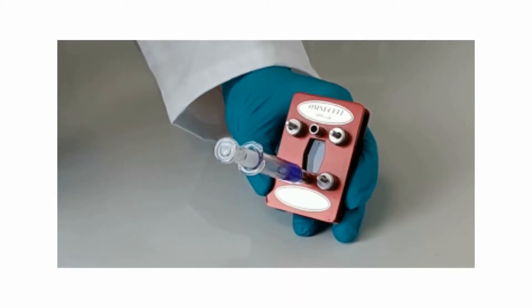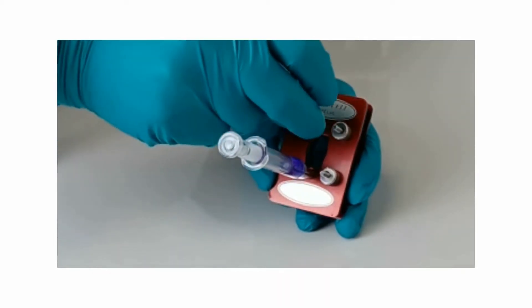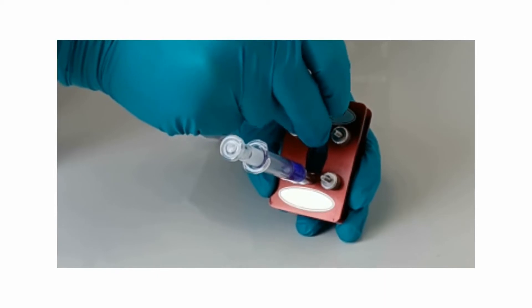Seal the top port first before removing the bottom syringe and sealing the bottom port.